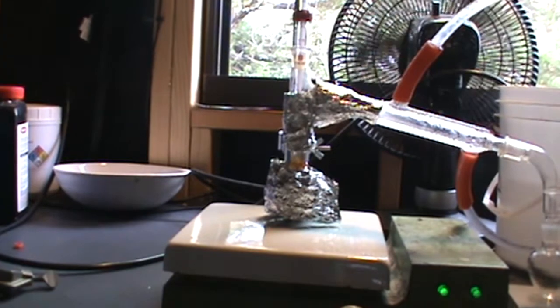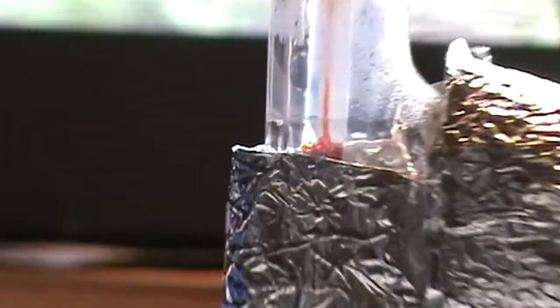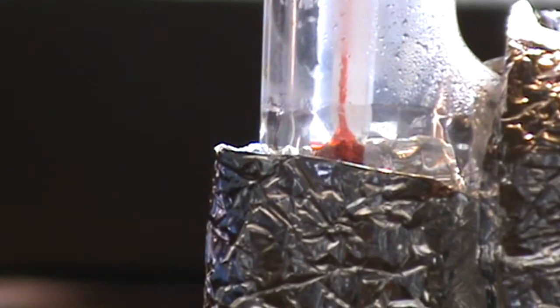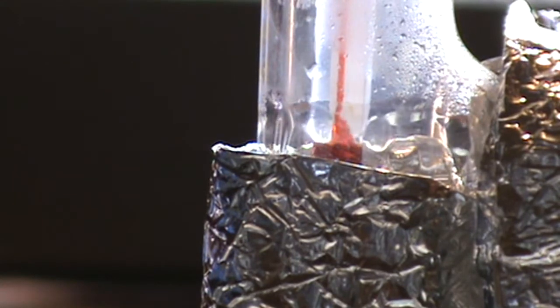After distilling off the chloroform, take apart the distillation apparatus, give it a good cleaning, and then put it back together. Make sure it's nice and dry.